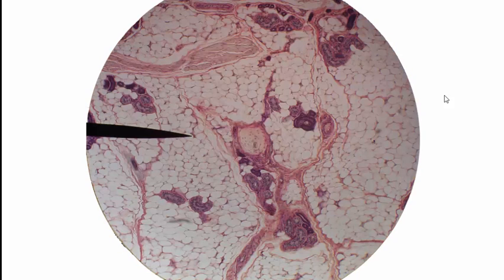Jumping around again, let's see what we see. What major layer of the skin are we inside of here? The answer to that question is we're inside of the hypodermis, or subcutaneous layer. What receptor is in the center of the field of view there? What receptor is this? That is a Pacinian corpuscle, or lamellar corpuscle. What does it sense, or what does it detect? It detects pressure. It's sensitive to pressure.